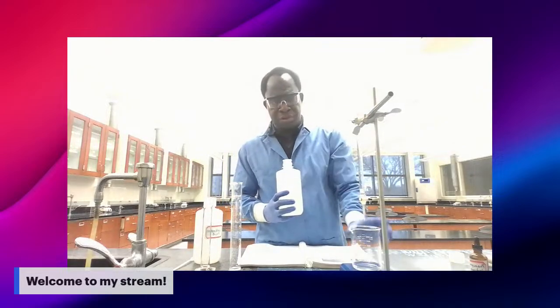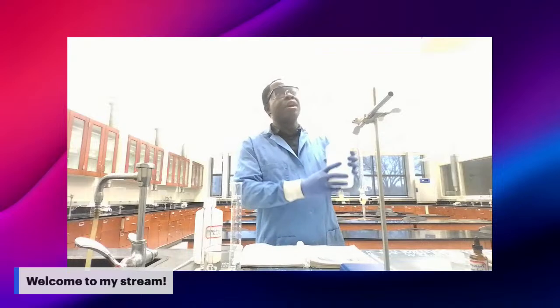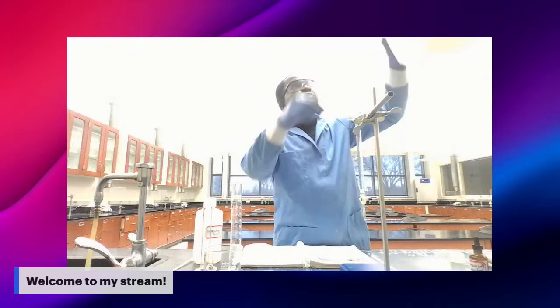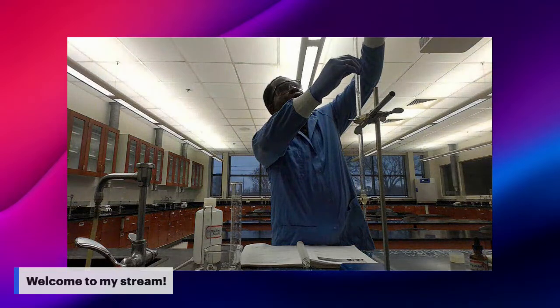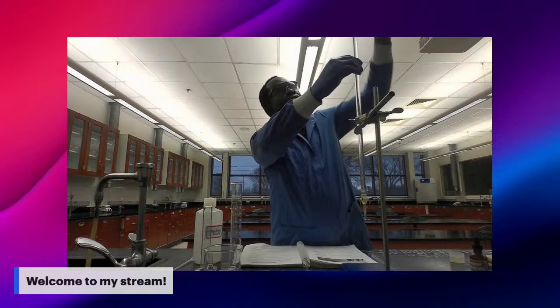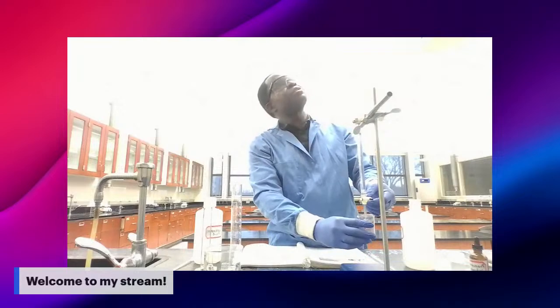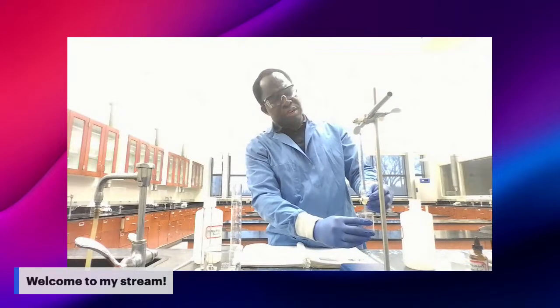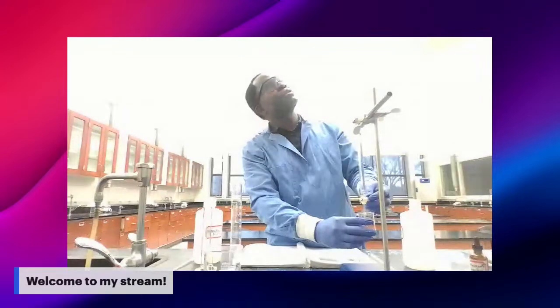Make sure you move your acid to the side, and then you can fill the burette to 0. To adjust it to 0, I have to let some of the base drain out.